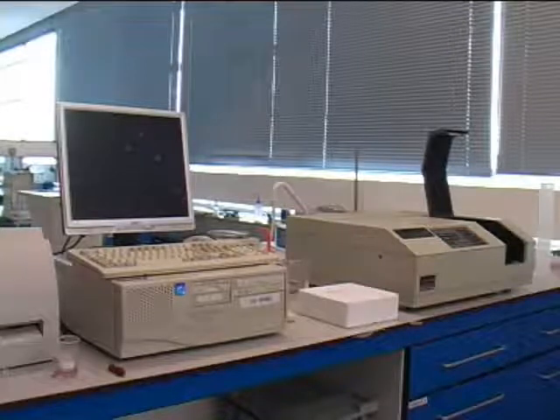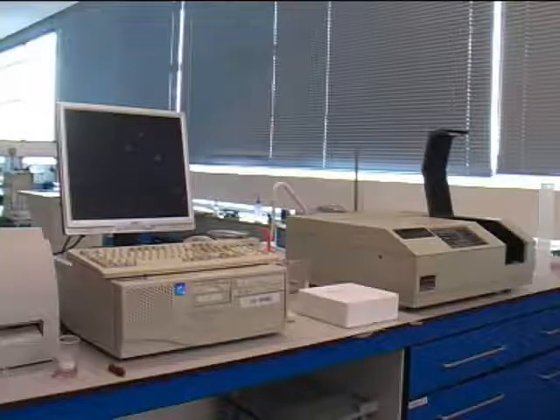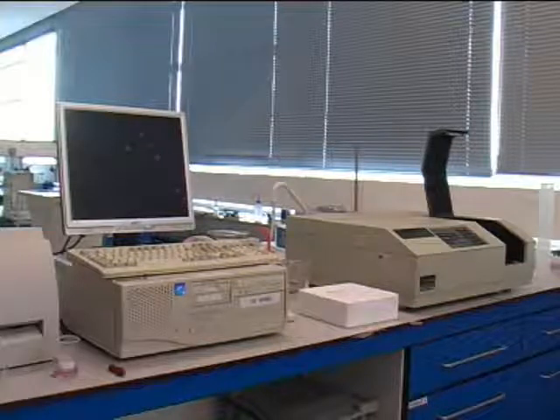This is the setup required for UV-Vis. On the right is a spectrometer, and on the left the computer which will be used to analyse the data.